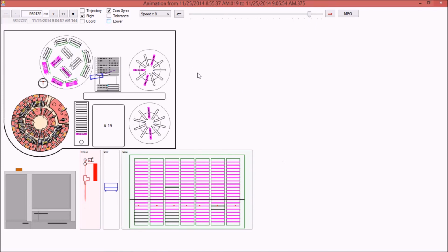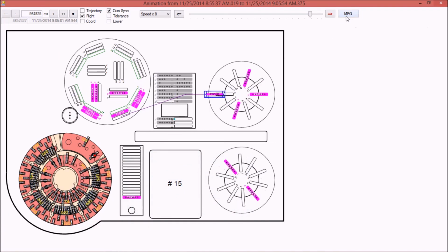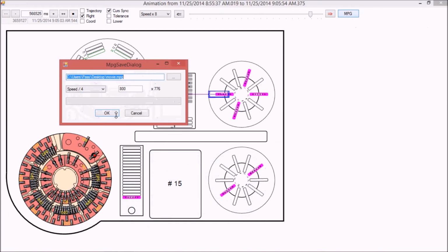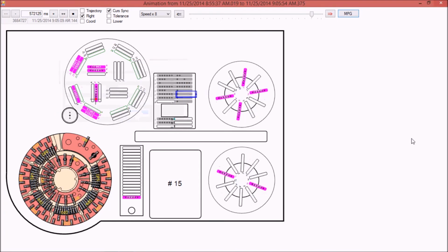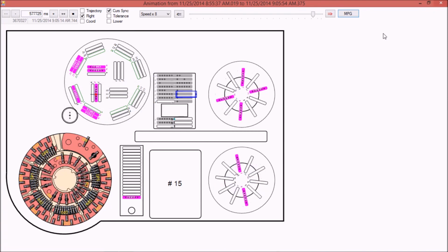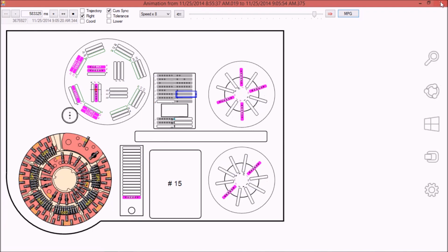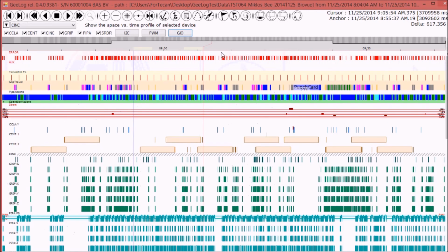It is even possible to store all this movie into an MPG file, which I will do then, that frees the customer from the need of using this package and can enable them to send MPG files that do not need a specific player to be played, can be played in a normal way or even published on a common site. So there are many other options which of course relate to the specific characteristics of this instrument.